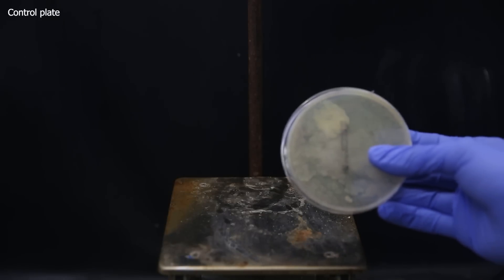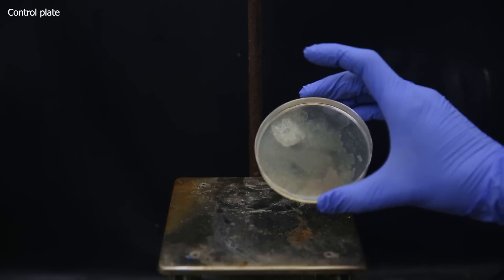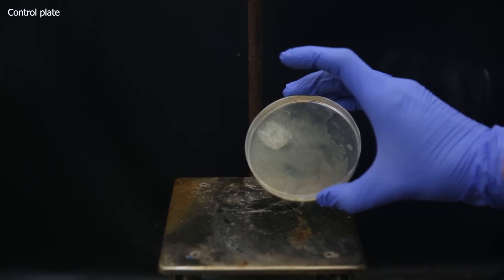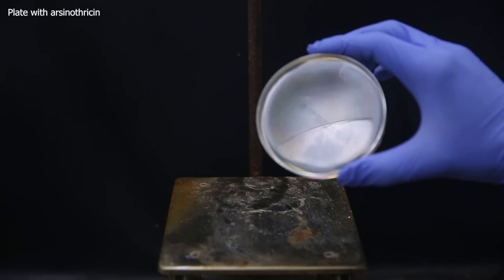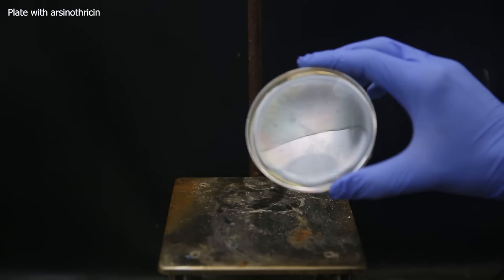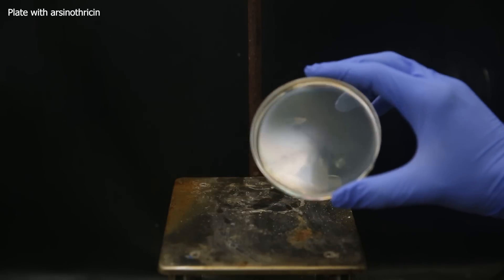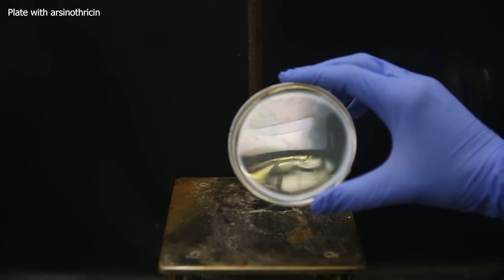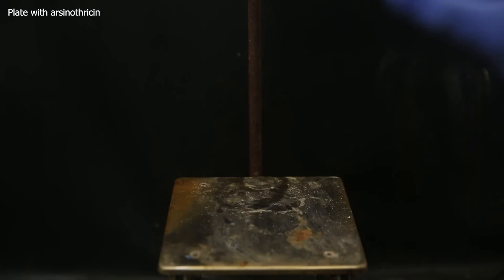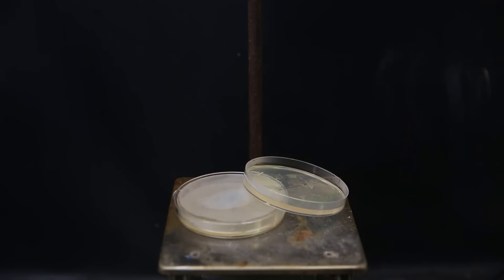After that, I take them out of the oven, and as we can see, the control plate looks all nasty. Now I'm actually surprised, because my plate with the antibiotic is pretty much fully clean — there's just some parafilm residue there, but I don't see any growth on the plate. Does that mean it worked, or that I messed up? I don't have any way to analyze this compound, so we're just going to assume it worked. Either way, it's about the journey, not the destination.